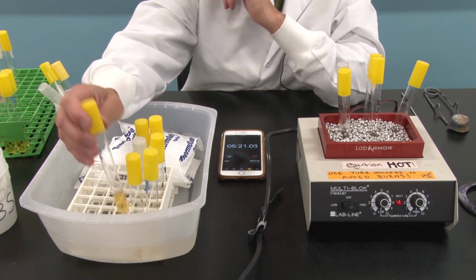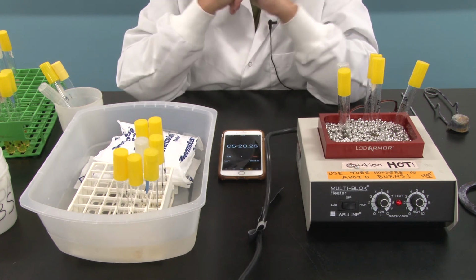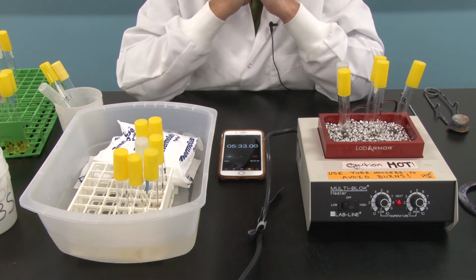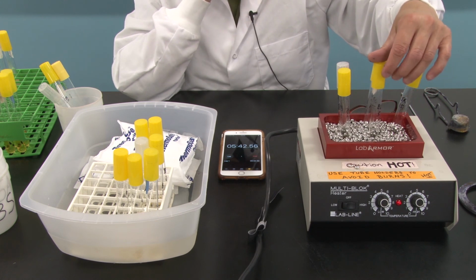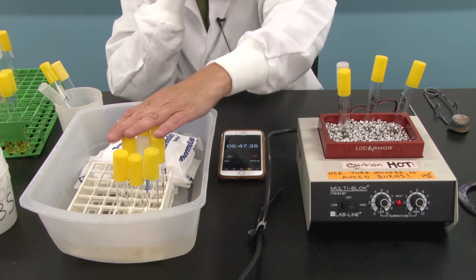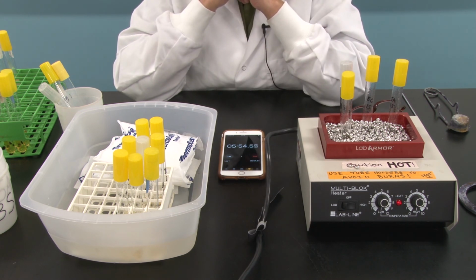Now we have the 5 minute SA. So we'll wait a few more seconds before we take the EC out because I did those after the Staph aureus. And then we'll give the Bacillus subtilis a few more seconds as well. So just kind of assume we were half a minute or so apart. I'll take the 5 minute E. coli out and we'll let this go a half minute more or so before we take the Bacillus subtilis out.